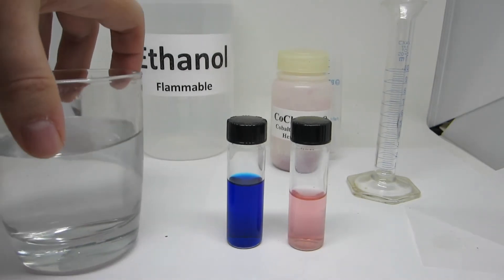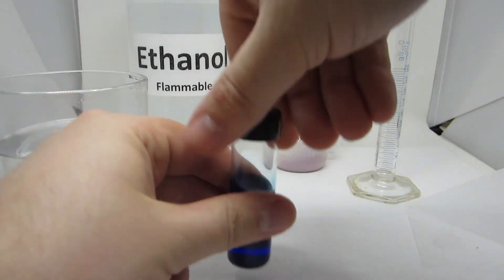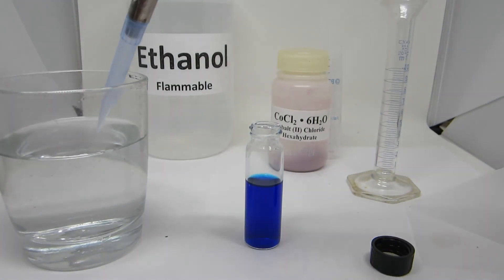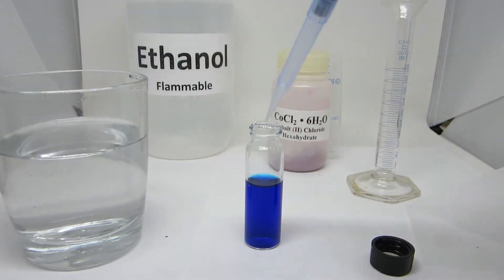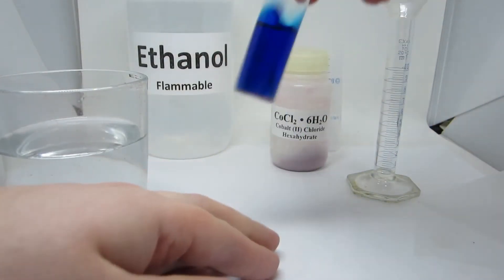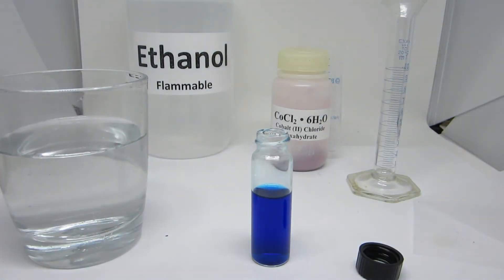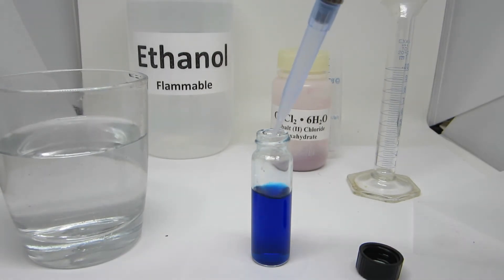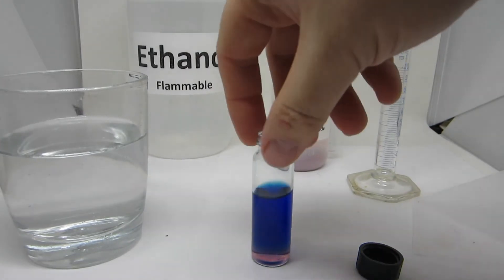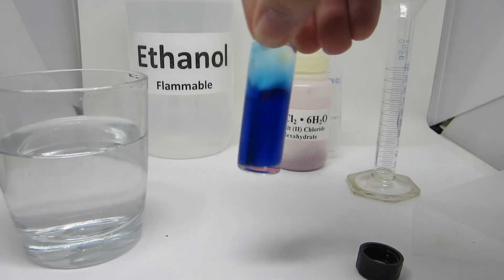To look at this, a known amount of water will be added to the blue solution. This will shift the reaction to make more of the red complex. With each addition, there are 200 microliters of water being added. Notice how the bottom, where the water settles, is becoming a red color. When the solution is blended, however, it goes back to the blue solution.